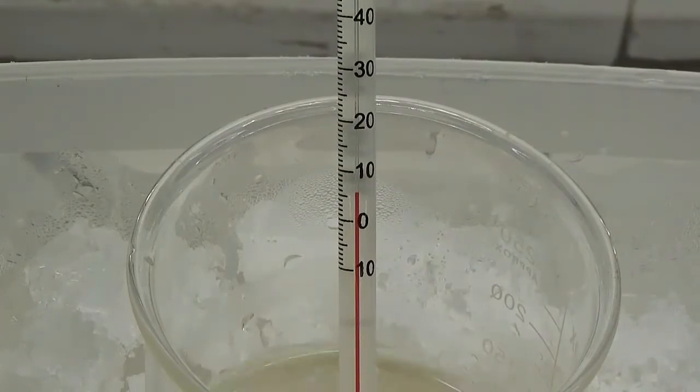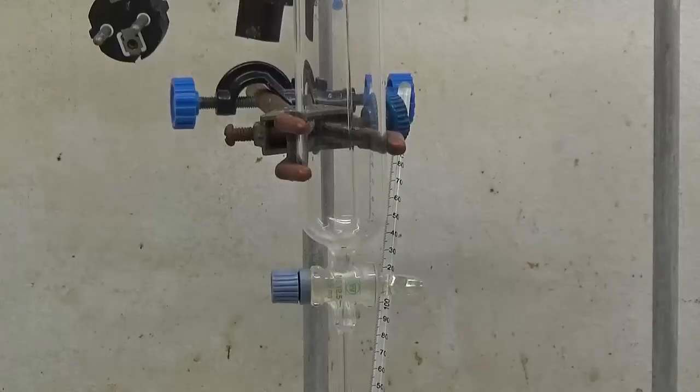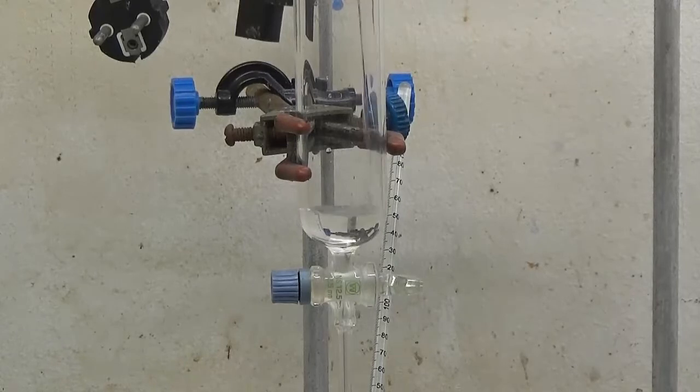When the temperature reaches 5 degrees Celsius, slowly add the hydrochloric acid sodium nitrite solution 3.